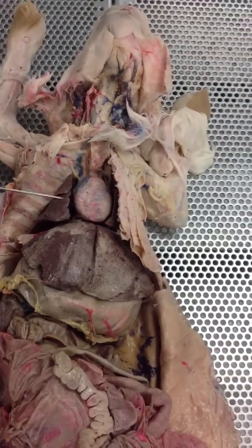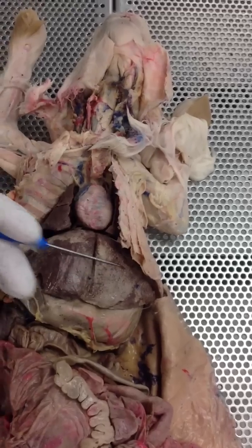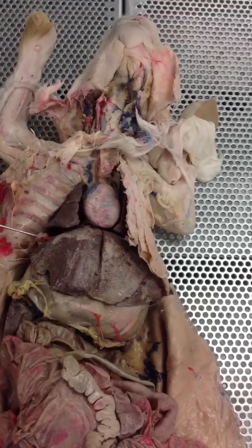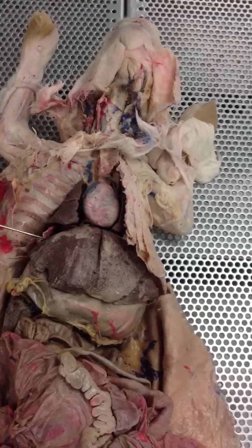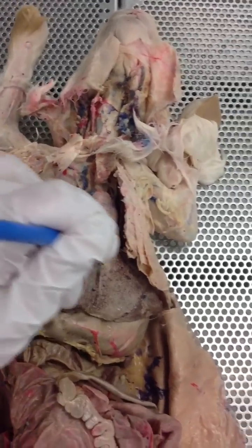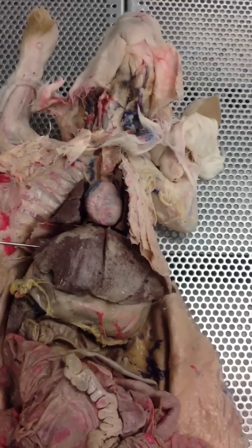Next to the pericardial sac, we've got the lungs. This big, large, brown portion here is the liver. This piece right here that goes all the way around is going to be your diaphragm.